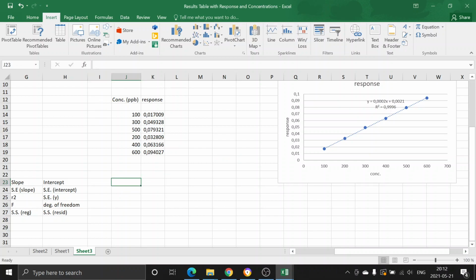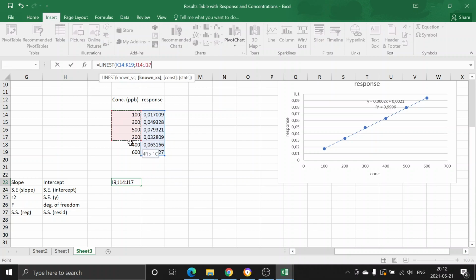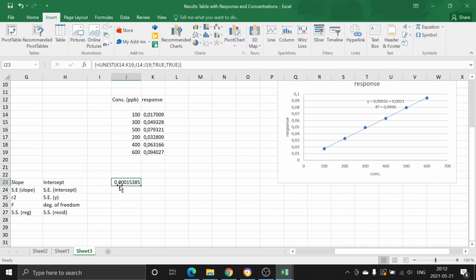So I will go to a cell, and I will say enter, and then I will say LINEST. Then I should select the known y values, which will be our response values, and then I say semicolon, and then I choose the x values. Okay, and then I insert another semicolon, and then I should say true, another semicolon, and then I say true again, and then I close the parentheses, and I guess I should say Control Shift Enter, and it gives me the slope value.